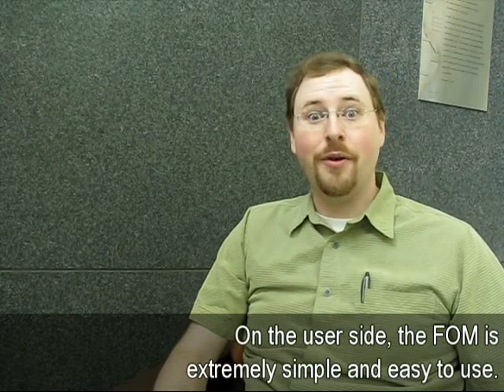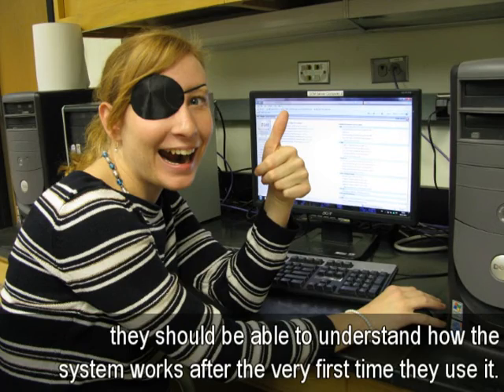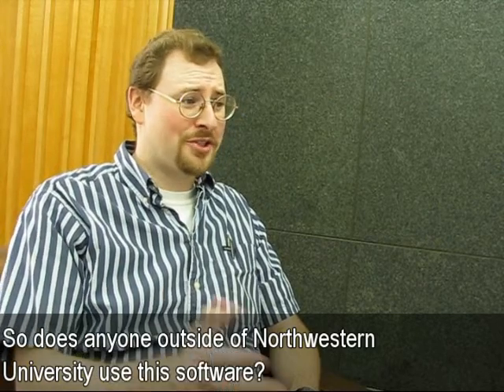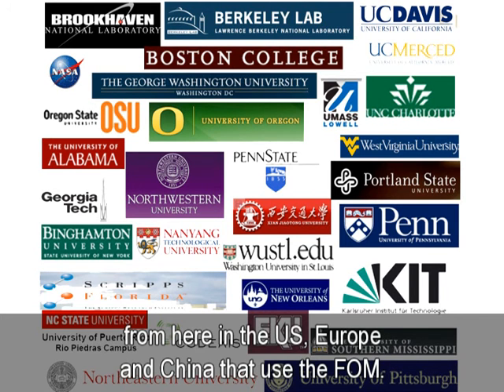On the user side, the FOM is extremely simple and easy to use. As long as the user has one good eye, they should be able to understand how the system works after the very first time they use it. So, does anyone outside of Northwestern University use this software? Well, here's a list of some of the more than 30 universities and national labs from here in the US, Europe, and China that use FOM.